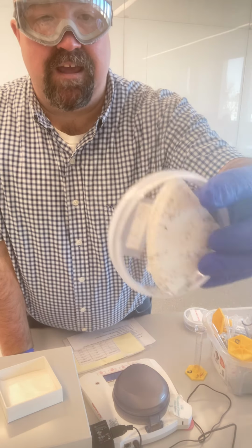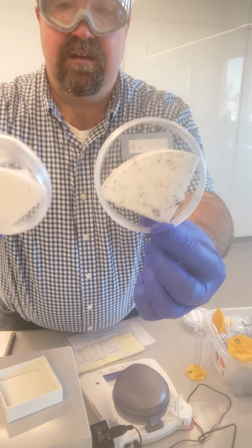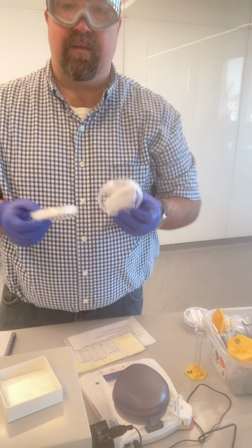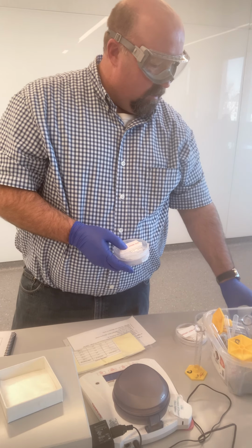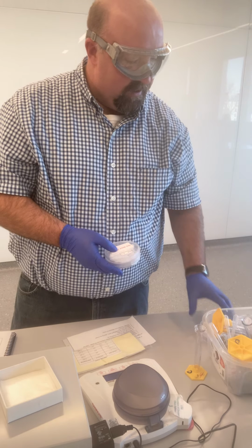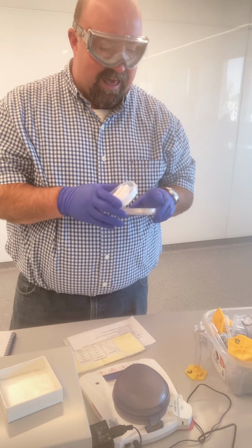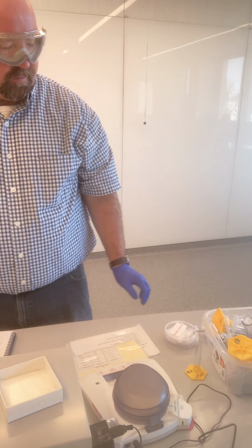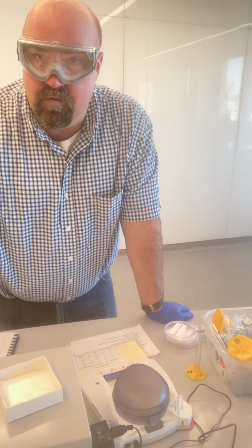Sample spot 4, just again by visual inspection, is by far dirtier than any of the others. And sample spot 5, I'd say, is somewhere between what 2 and 3 looked like, but not to the point that sample spot 4 was. Again, by visual inspection, I don't see much solid in sample spot 1. Sample spots 2 and 3 have a little bit of solids in there. Sample 4 appears visually to have the most. And sample spot 5 looks to have less than sample spot 4, but more than what 2 and 3 had.